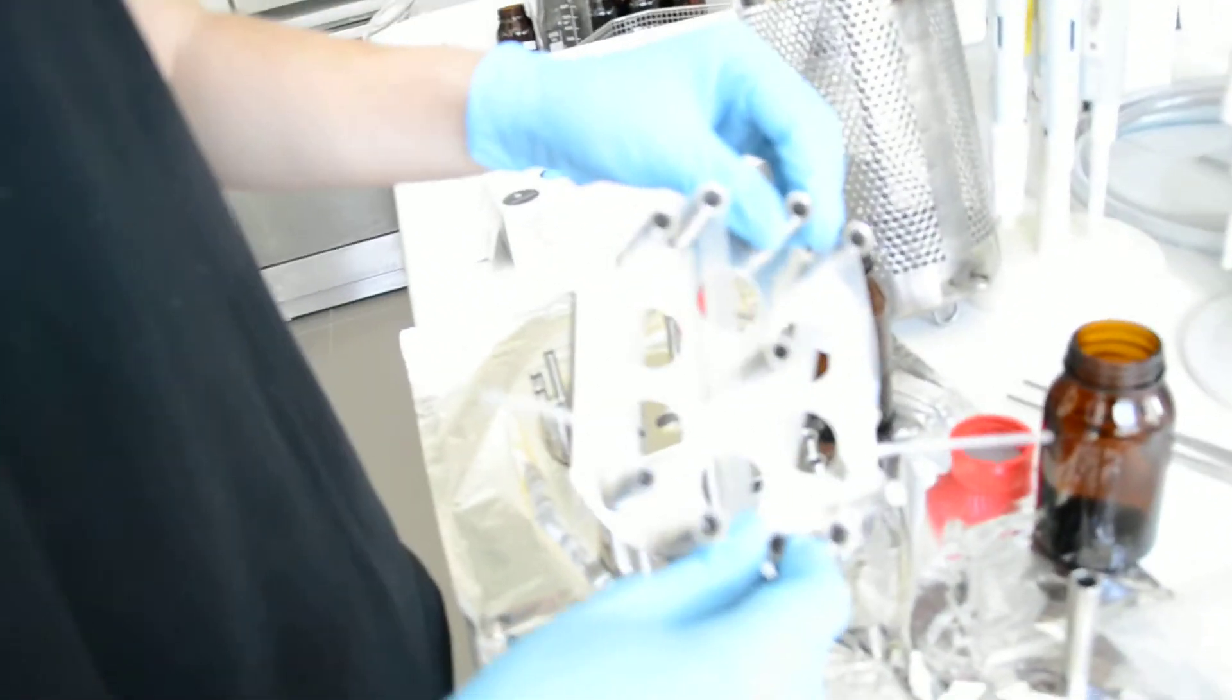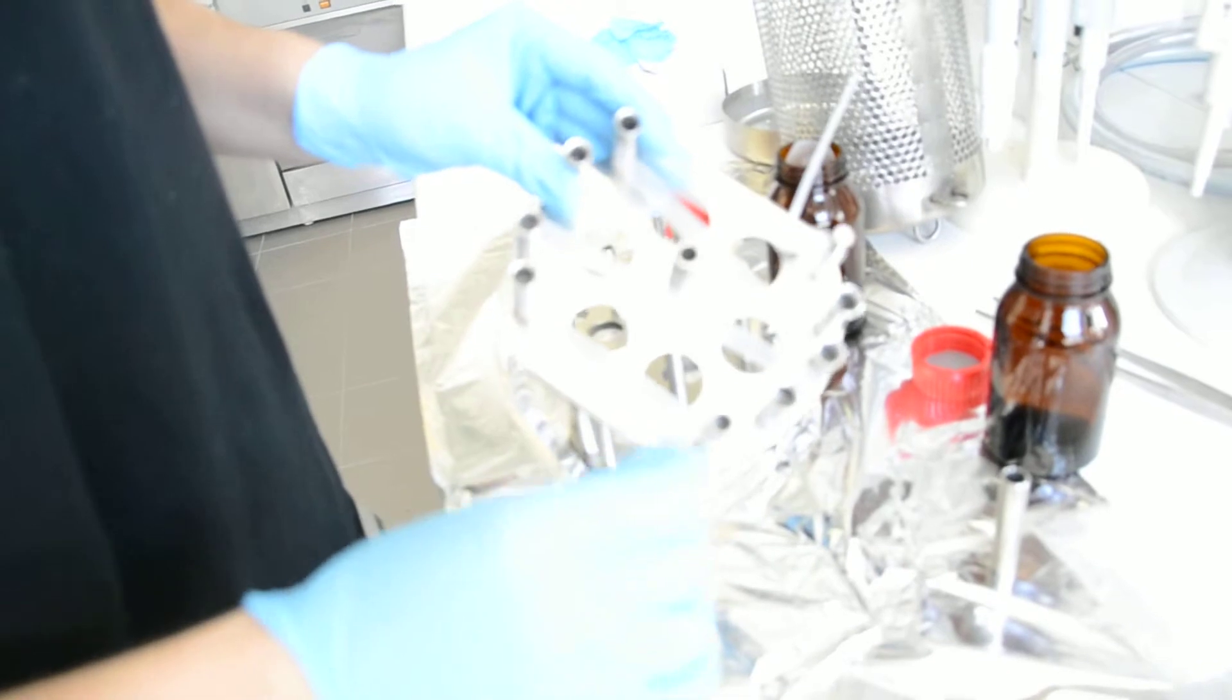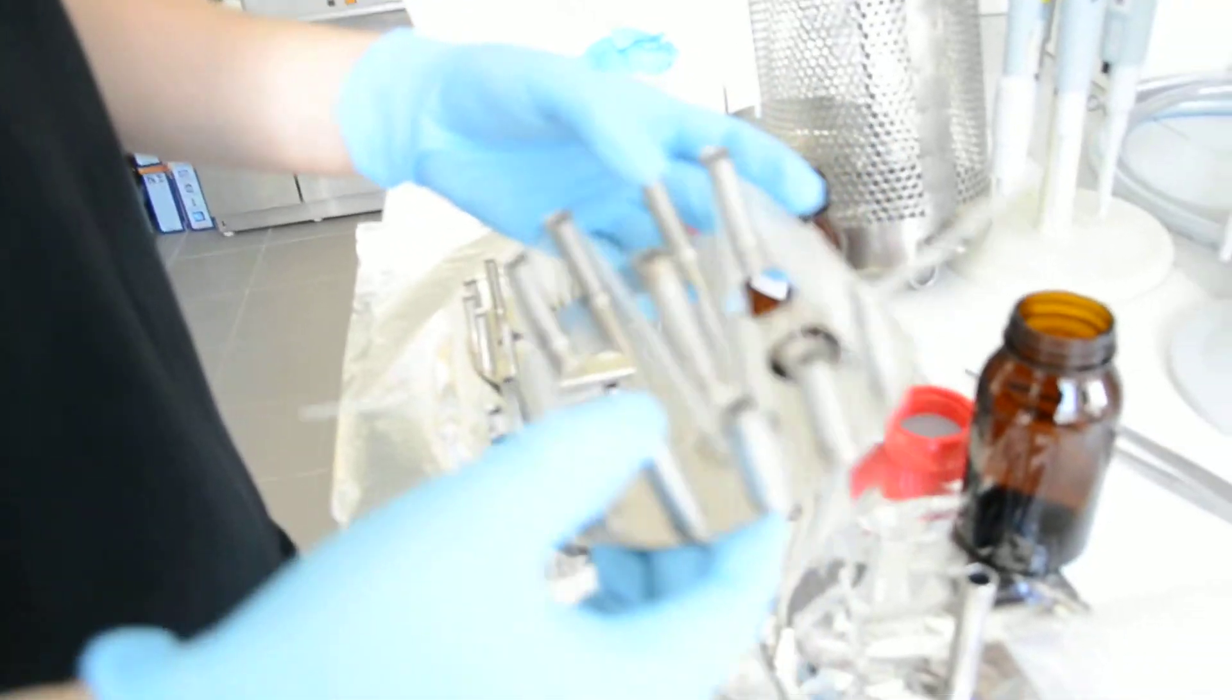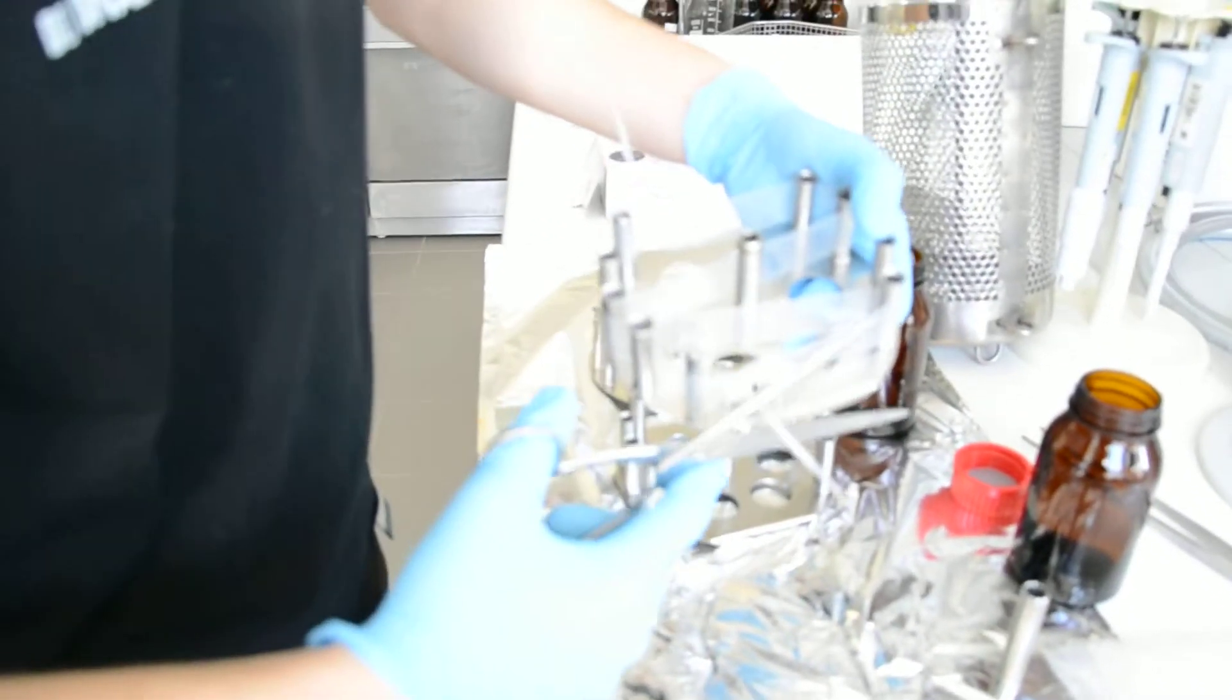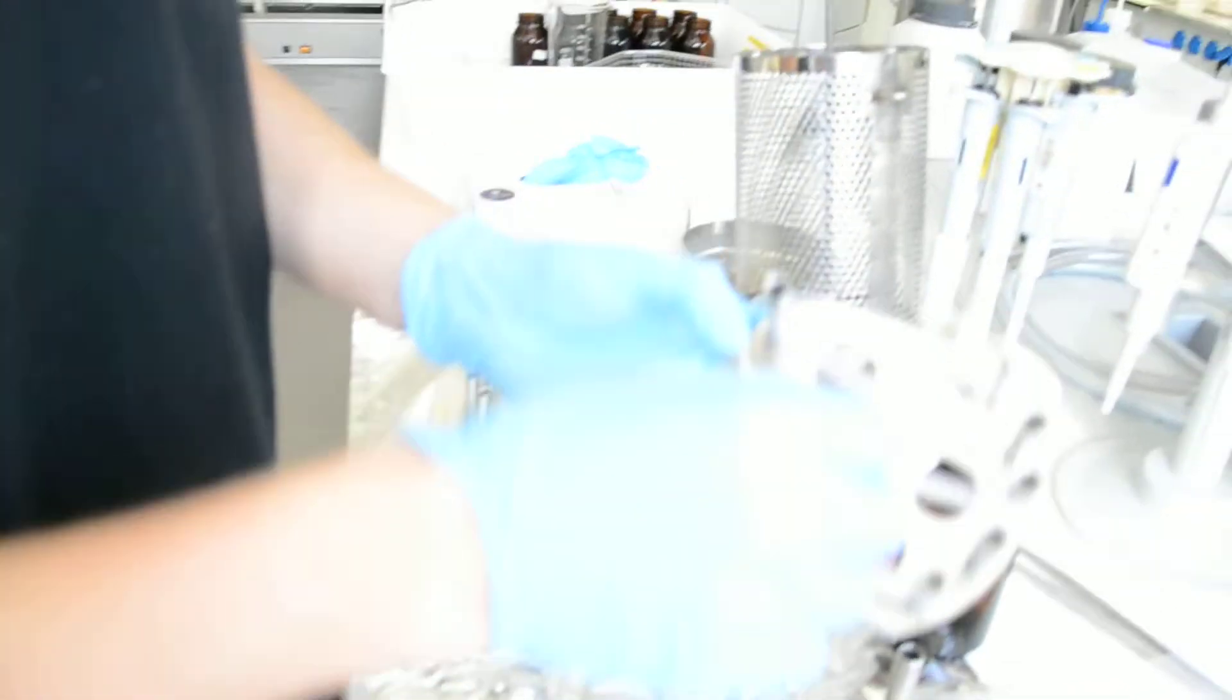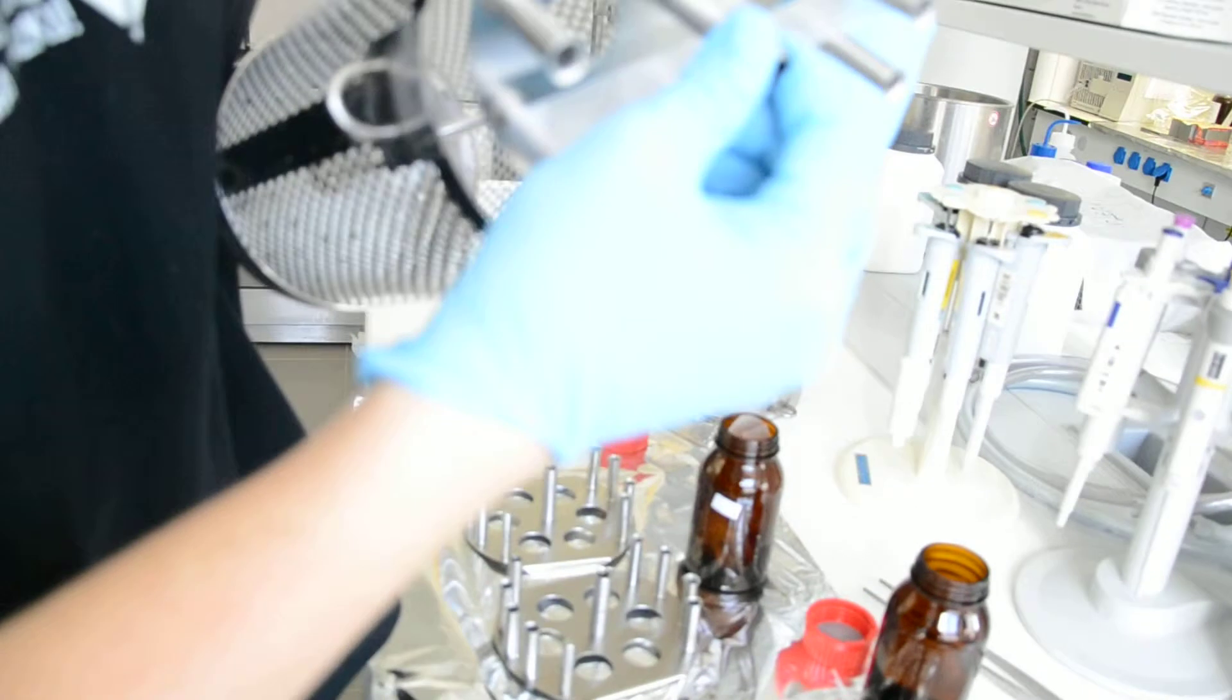The spider is prepared. It's good that you cut this remaining part with scissors like here. And then as you prepare three spiders like this. I cut this part, this part. And you can put three of these spiders with silicone rubber inside the cage.